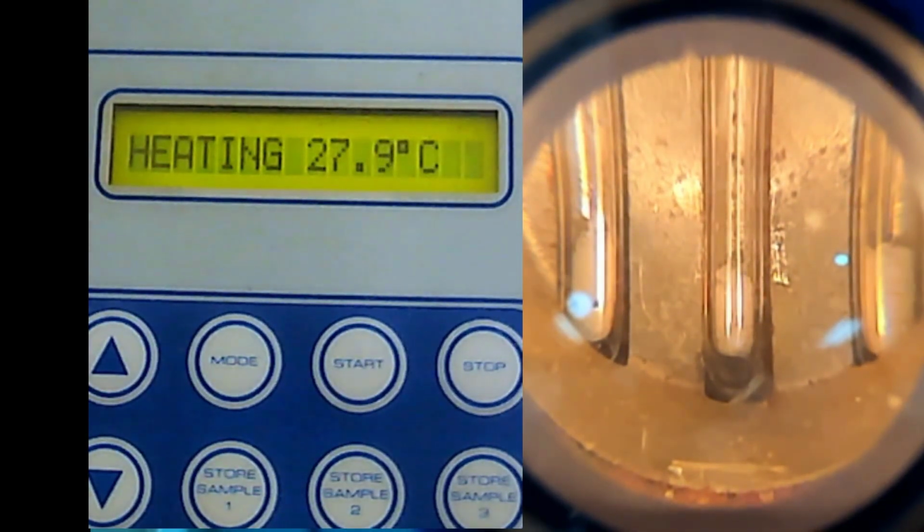If you look here, the experiment is quite straightforward. But during the physical lab, this is the longest experiment. I mean, not the longest, I mean the most boring experiment. The students need to wait. As I said before, when you are in the lab, there are many groups, and we only have a few melting point instruments.